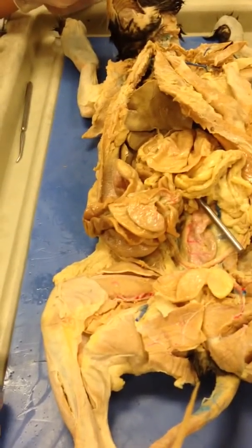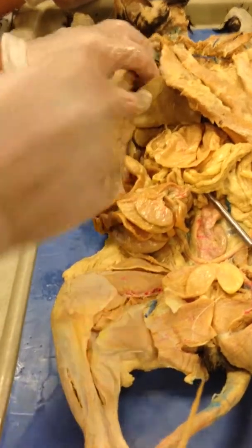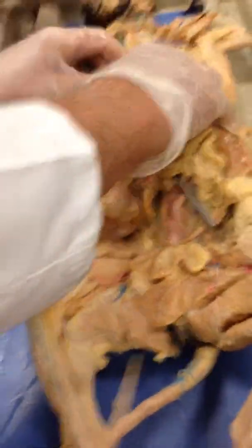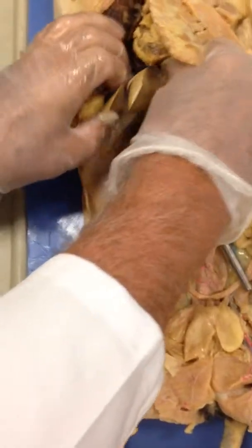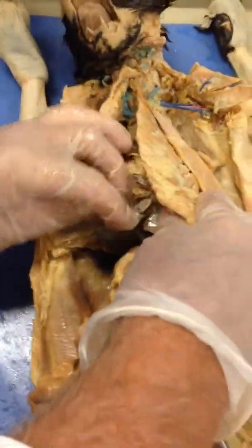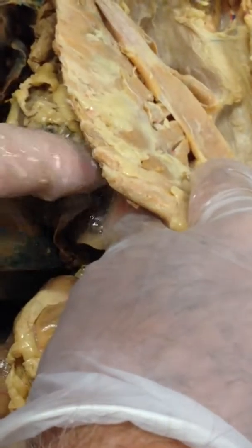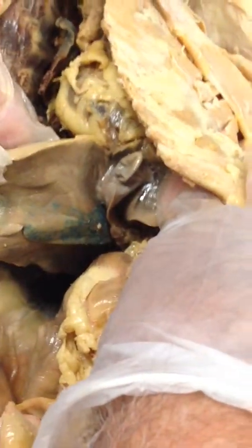The only thing, the gallbladder. You didn't find the gallbladder? Did you look up here between the lobes of the liver? I just moved it around. I didn't know it. See that right there? See that little sac-like structure right there? That should be it. See it? The gallbladder. It's like it's collapsed. Oh, wow. I didn't know it.